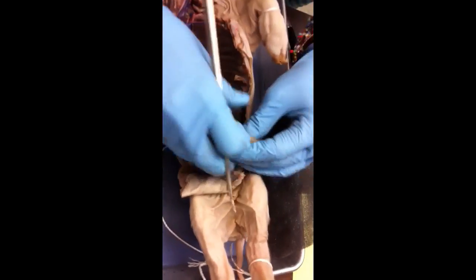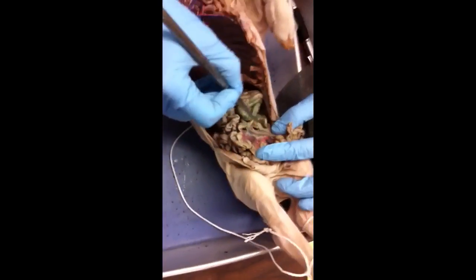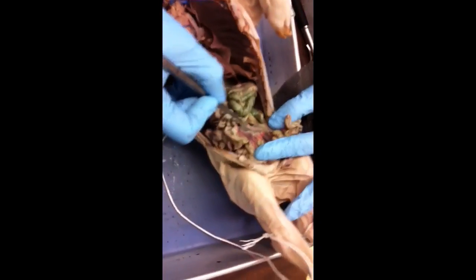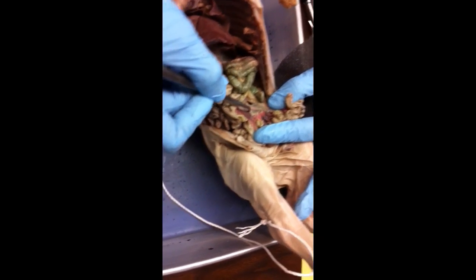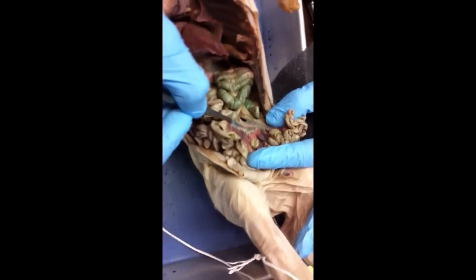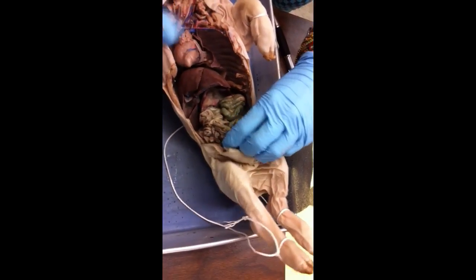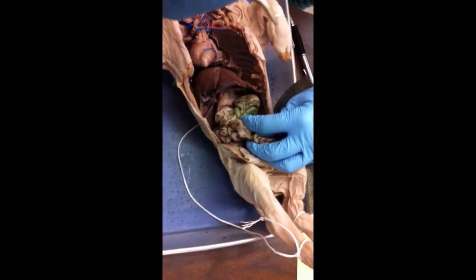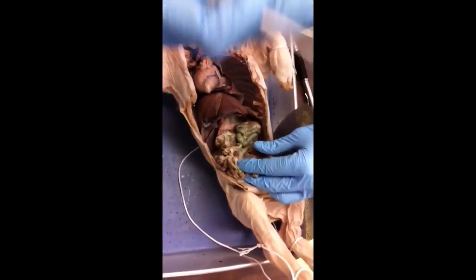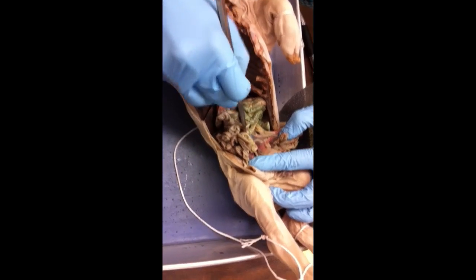To the intestines. Further down the small intestine, at the base, this is what I was talking about. You guys see these little node-like structures down here? Those are the Peyer's patches. So, which system is that? Lymphatic system, basically filtering lymph. Remember, all the lymph tissue is filtering the lymph fluid for any kind of bacterial or foreign bodies. Okay, so those are the Peyer's patches.